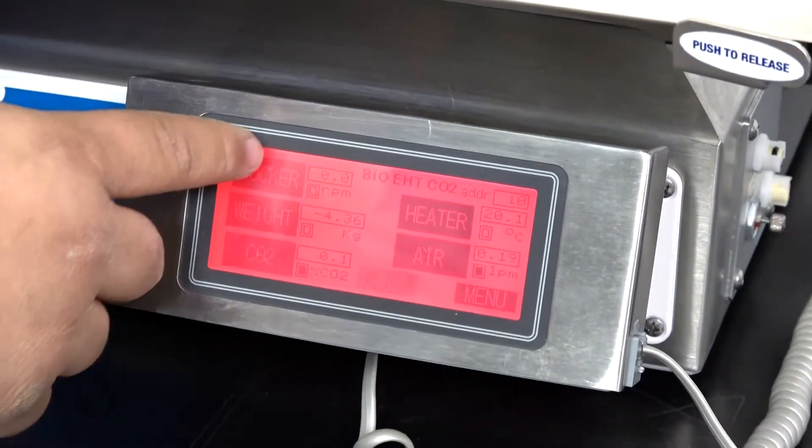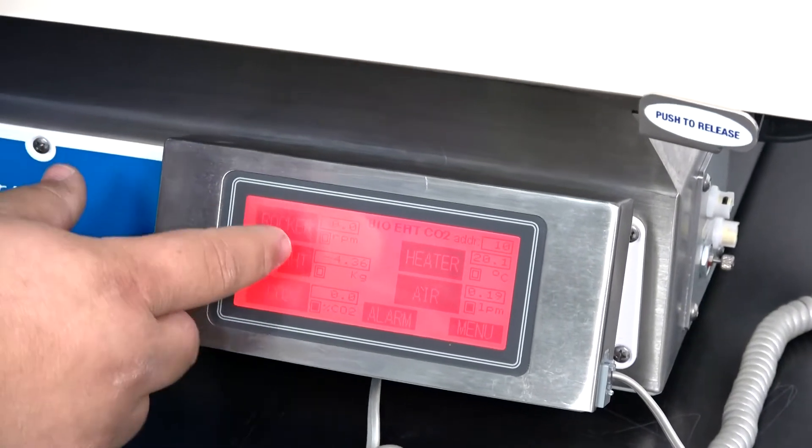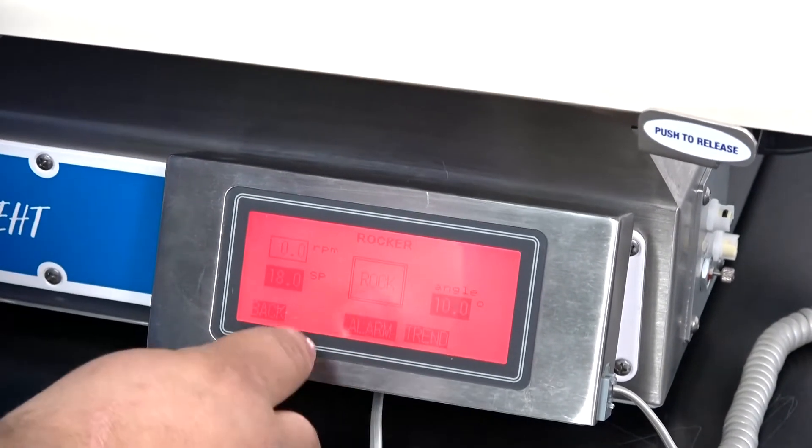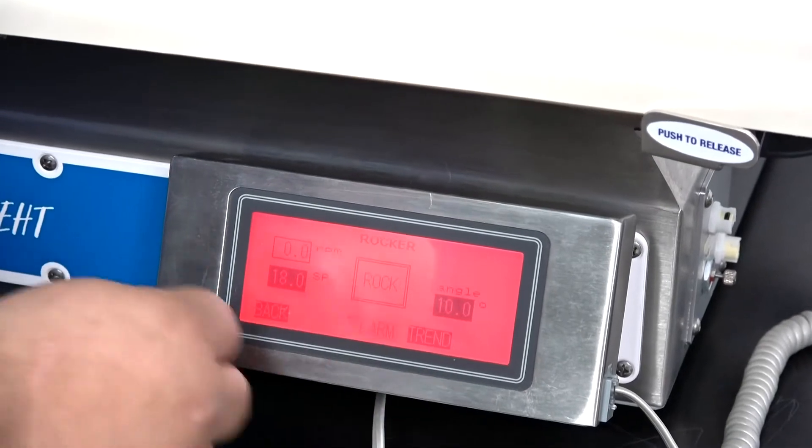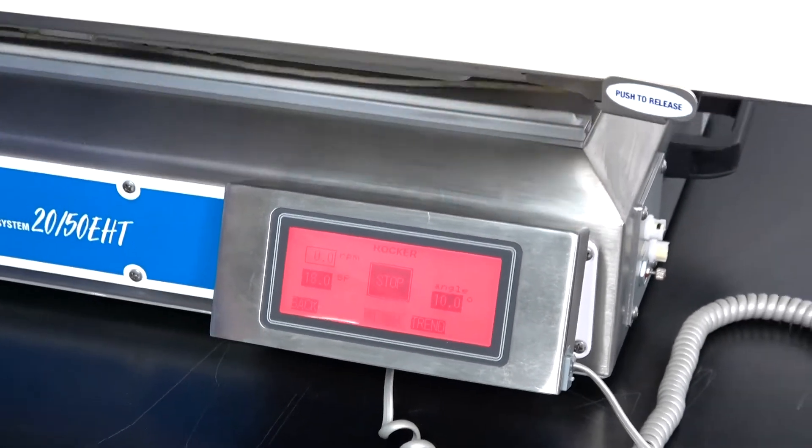To start this right up, we'll hit the rocker. Here, close this lid, hit the rocker button, and hit rock. You can see she'll start to move.